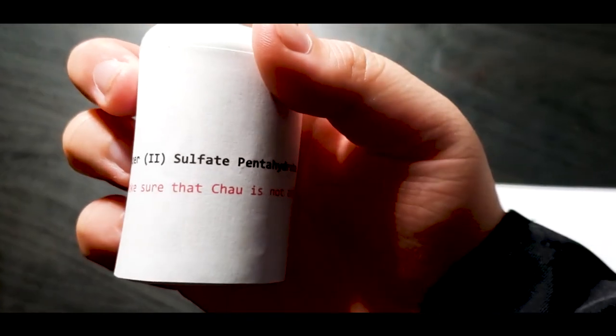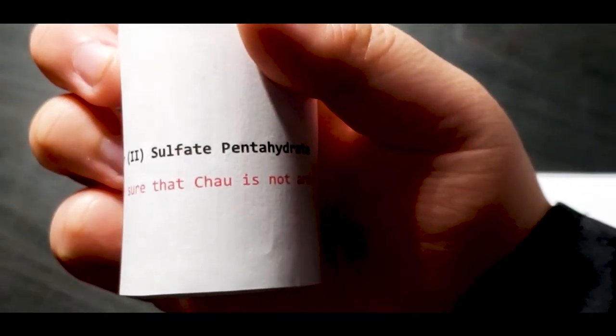Copper-2-sulfate pentahydrate. Did someone just say copper-2-sulfate pentahydrate? Gotta dehydrate it.